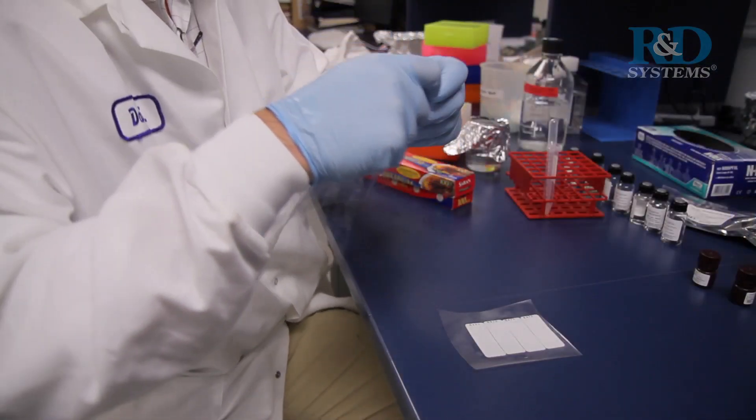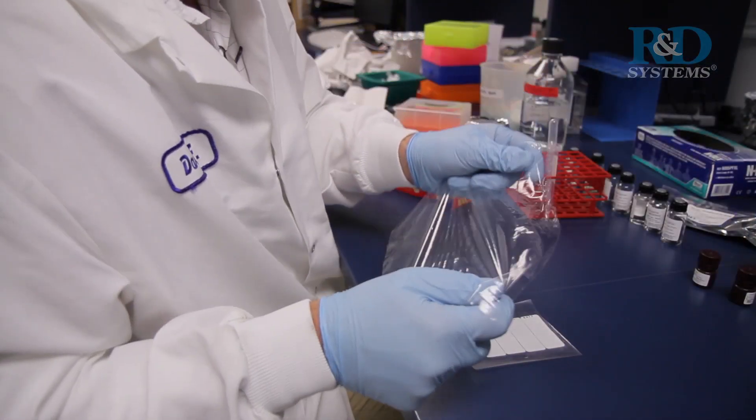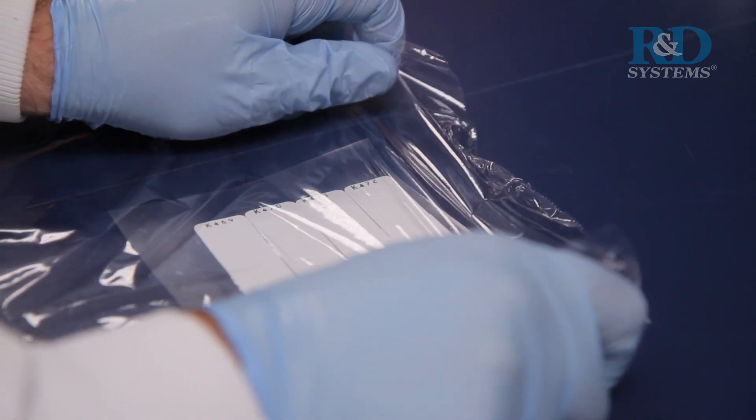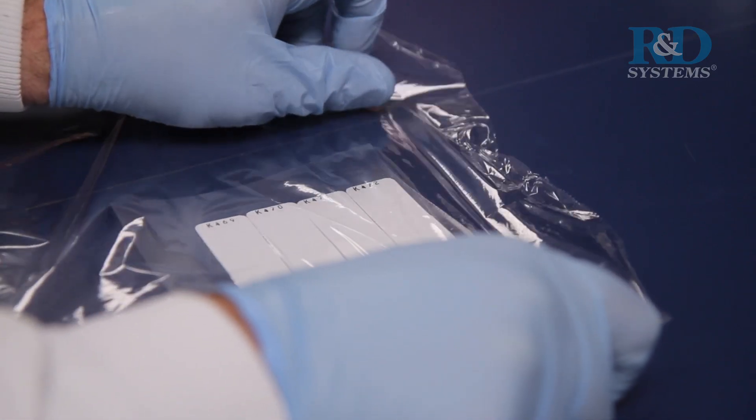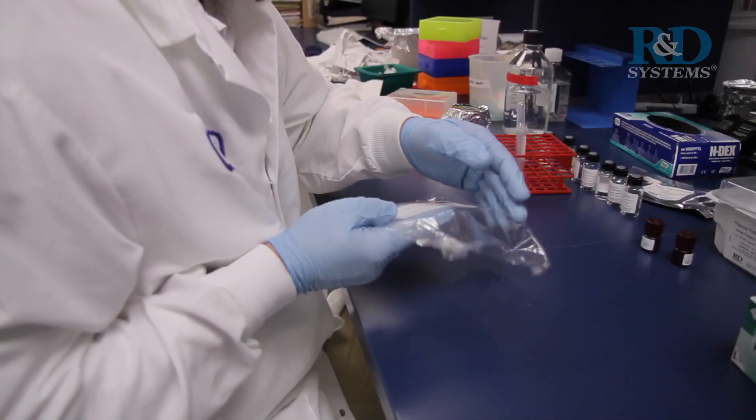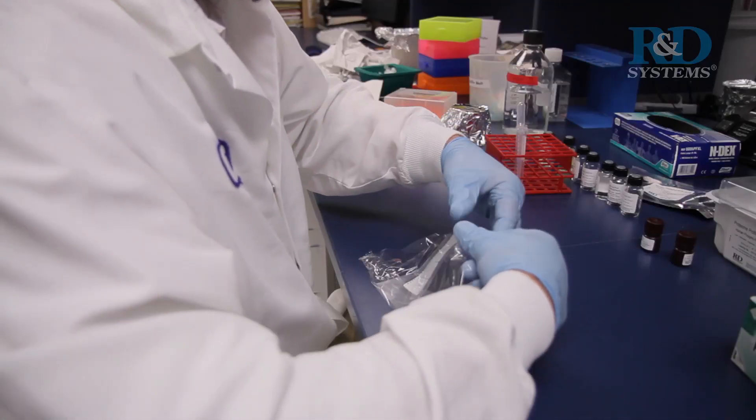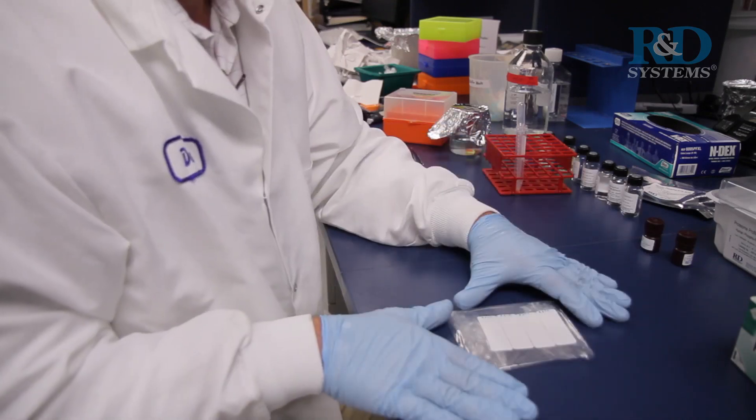Leaving membranes on the bottom plastic sheet protector, cover the membranes with plastic wrap, taking care to gently smooth out any air bubbles. Wrap the excess plastic wrap around the back of the sheet protector so that the membranes and sheet protector are completely wrapped.